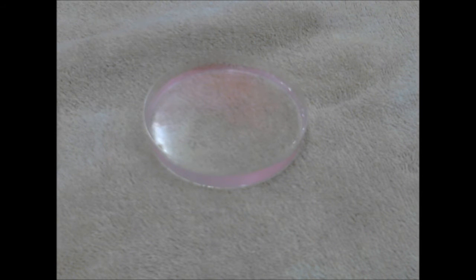So at this point, I'm going to put some sodium metal into a petri dish filled with water. This petri dish also has some phenolphthalein indicator added to it. The phenolphthalein will turn a bright, vibrant pinkish color in the presence of a strong base. So you'll notice if there's actually sodium hydroxide being produced. So at this point, I'm going to put the sodium into the water.